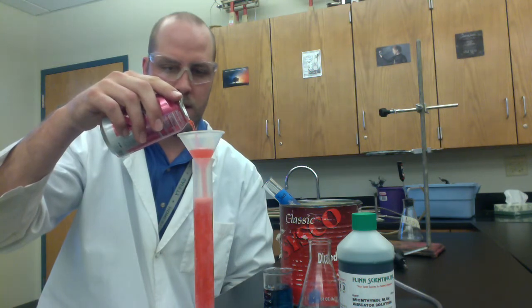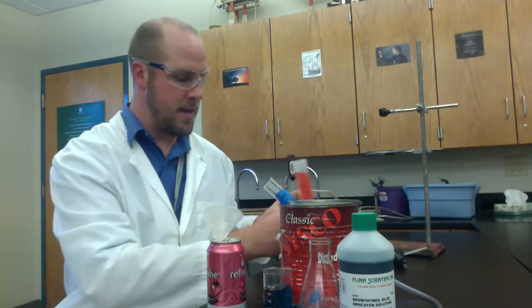Obviously you don't want to measure the carbonation level, you want to measure the actual volume of soda level. That brings us to a little bit over, so I'm going to pour a little bit back. One thing I ask in this lab is just to be careful to rinse everything off, whether it's a graduated cylinder or a funnel or tabletops. Soda gets kind of sticky and gross if it gets left places.